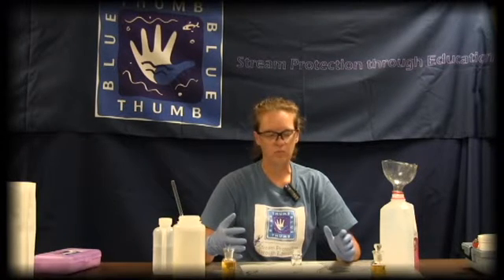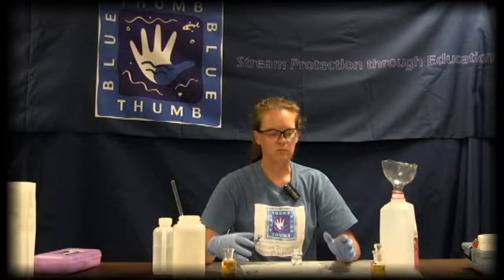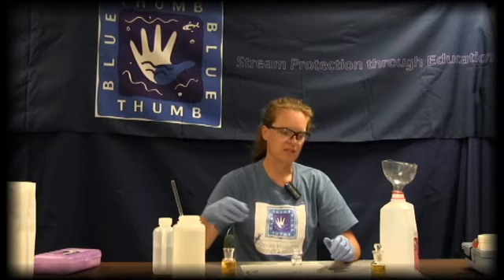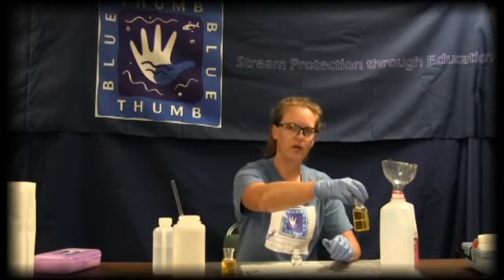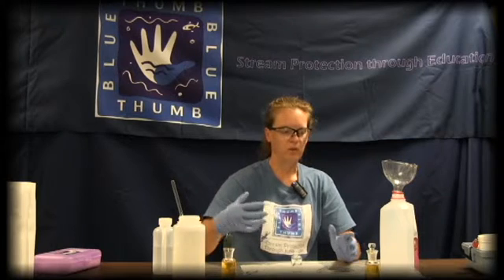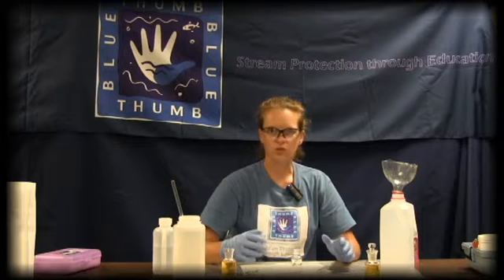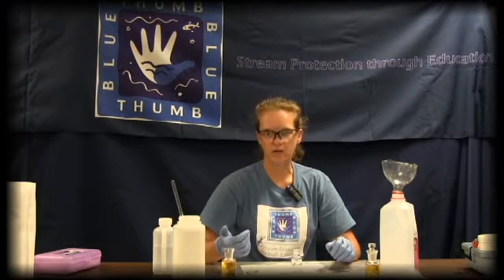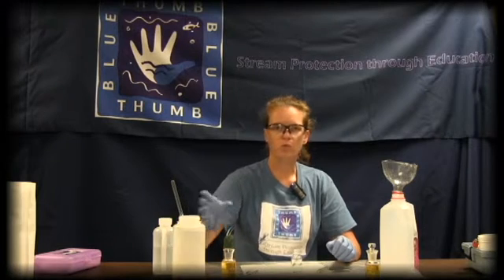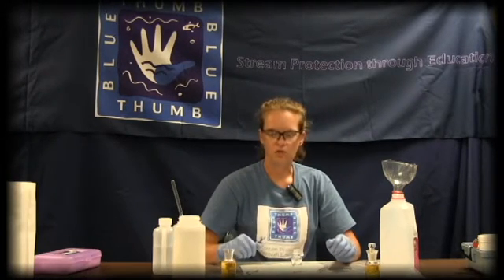It is very important to be within at most two drops difference between the two dissolved oxygen bottles. Anything more than that, and as mentioned, you have plenty of solution to go back and retest bottle one and bottle two — maybe those second testings will give you repeatability. If it's still more than two drops difference, you will need to go back out to the creek, refill both DO bottles, refill your sample water bottle, refill the front of the data sheet, and do it all over again.